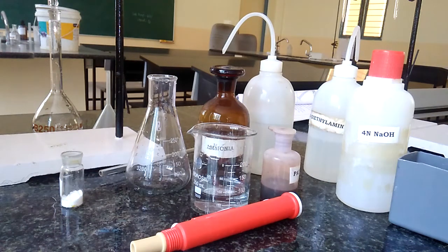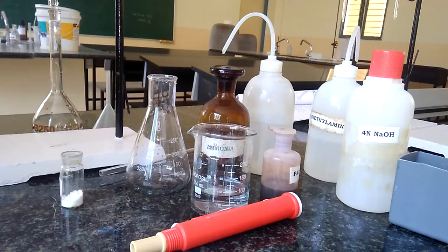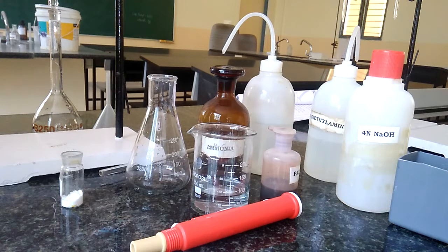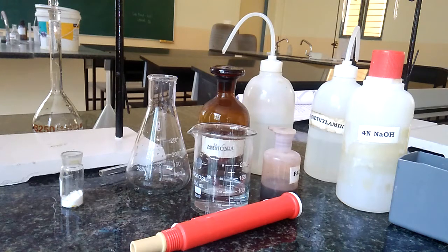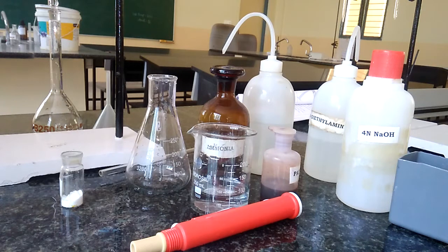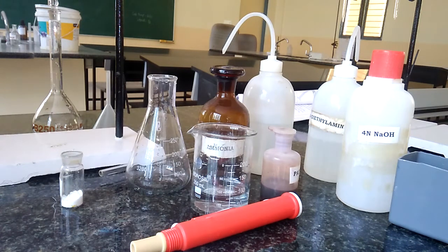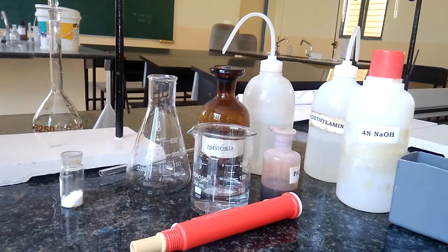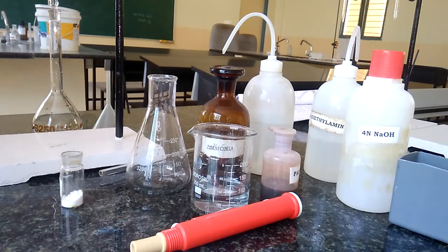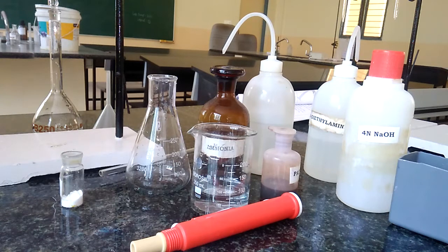Dear students, today I am going to give the demonstration of estimation of CaO — that is calcium oxide — in the given cement solution. This experiment can be performed in three different steps. The first step is preparation of disodium salt of EDTA as a standard solution. The second step is estimation, that is titration against standard solution. And the third step is calculations.